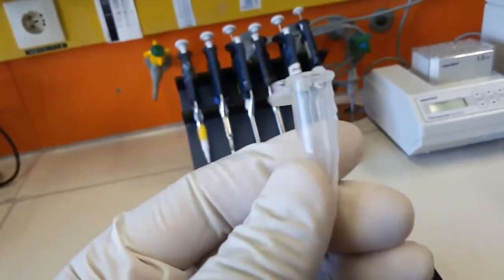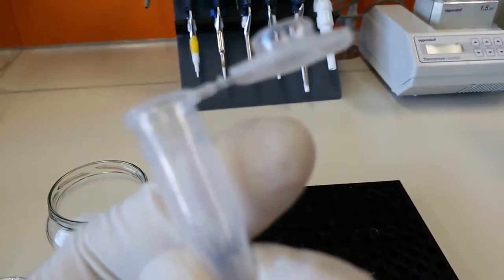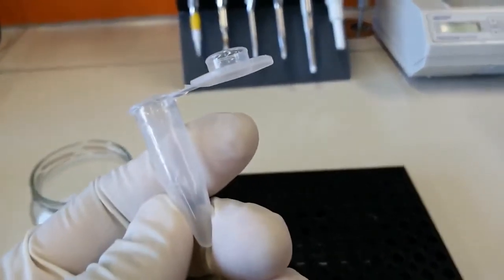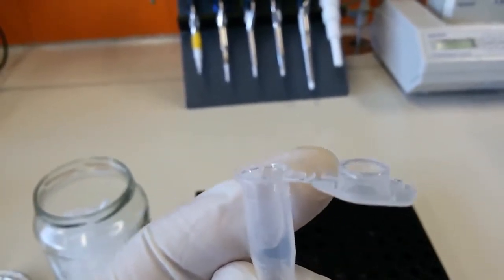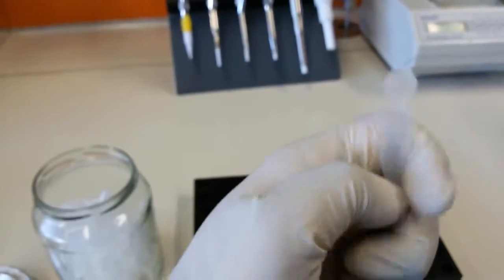Now I can pick some tubes and show you what they are. So this is a 1.5 ml tube, and it's written somewhere 1.5 ml. Let's find out where it is. Just give me a second. So you can see this is 0.5, this is 1, and this is written 1.5 ml. So this is a 1.5 ml Eppendorf tube. That's how we close it, and we can open them like this.